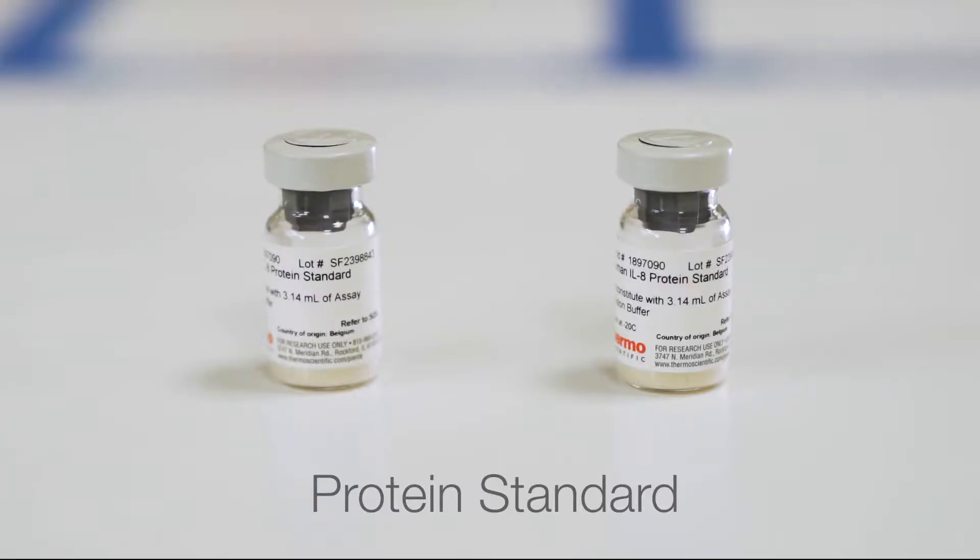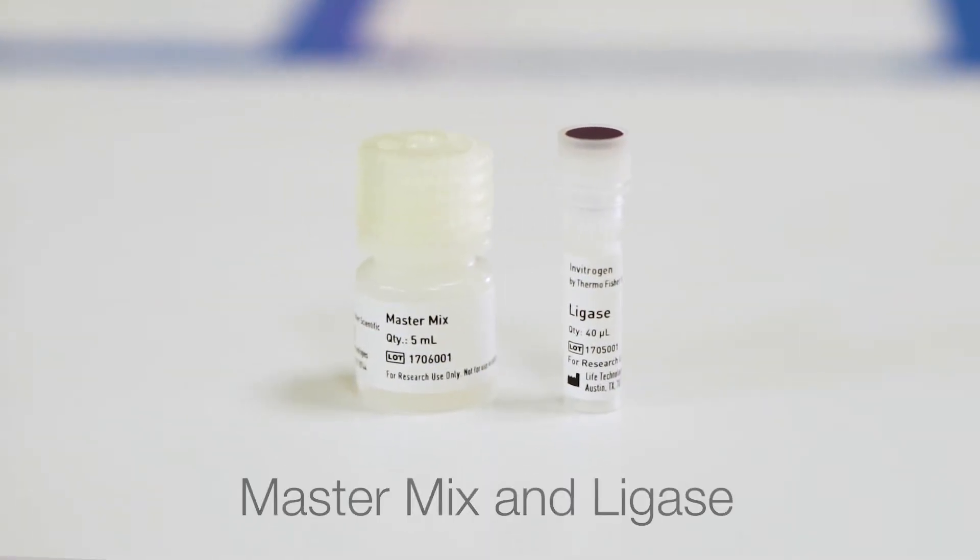Two vials of standard for two runs using freshly reconstituted protein. The master mix and the ligase in the purple cap will need to be mixed for the qPCR step.